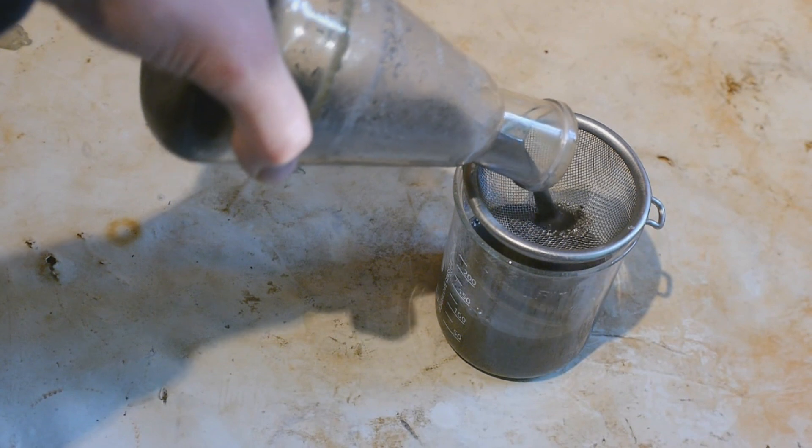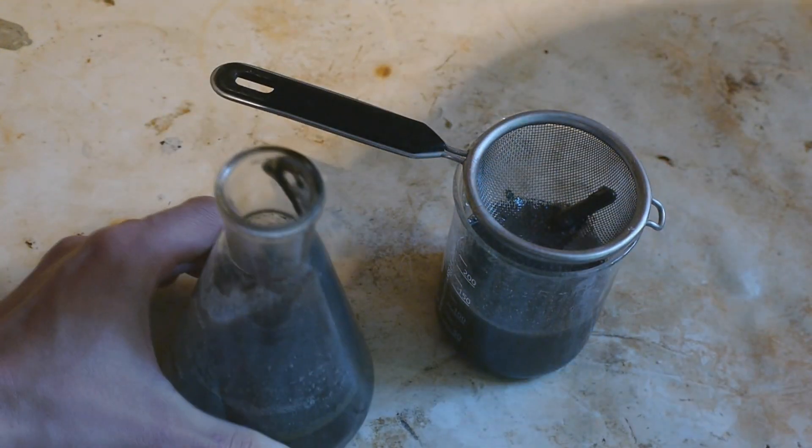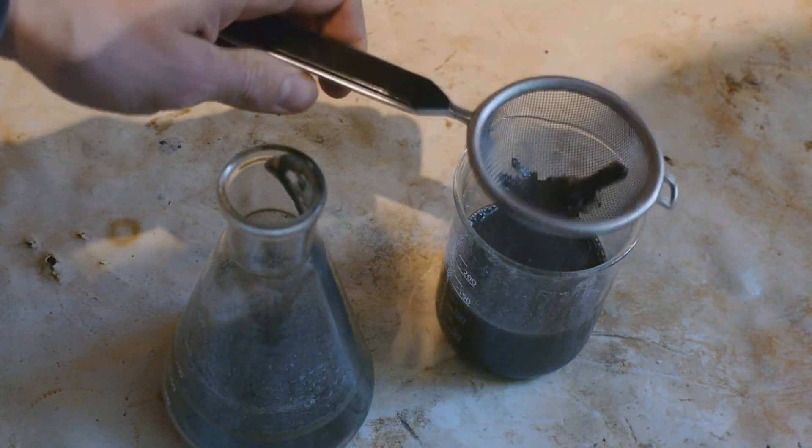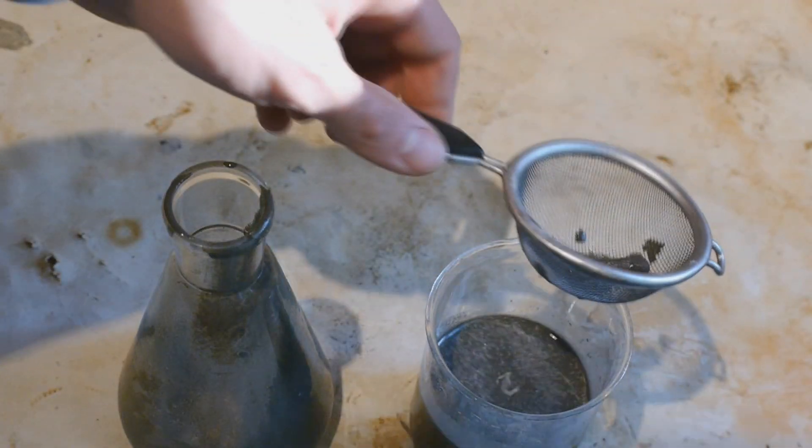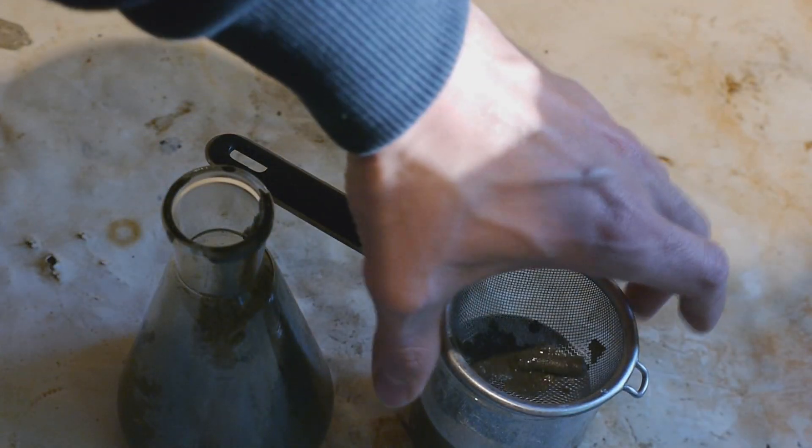Oh my god. No! It was just a collection of lots of tiny droplets. I will definitely have to seek some help now because I don't really have a clue what I'm doing wrong. And maybe someone can tell me.